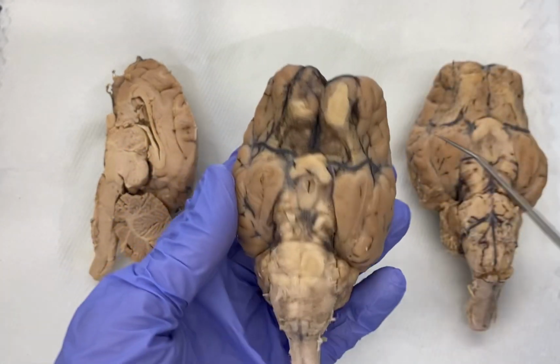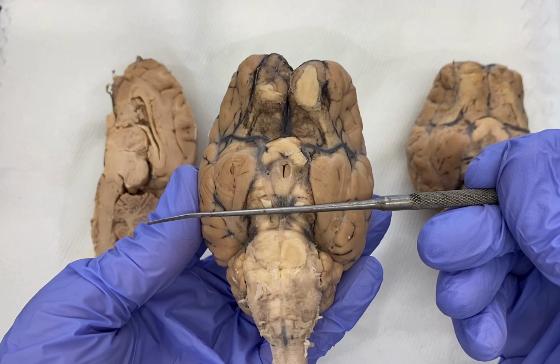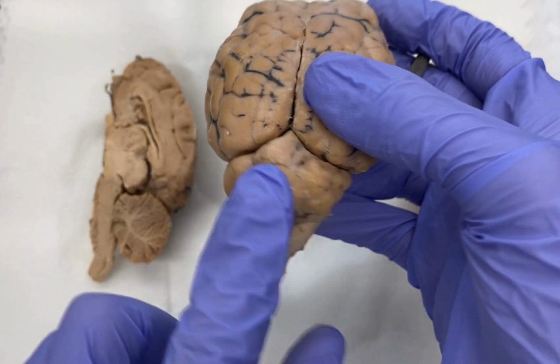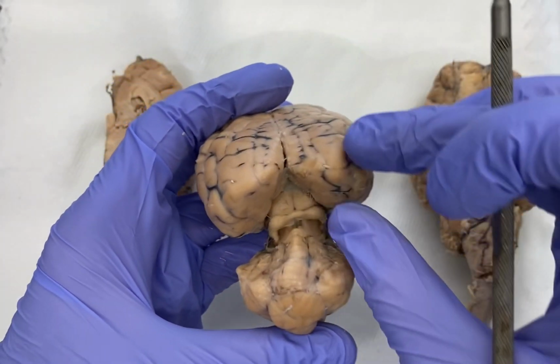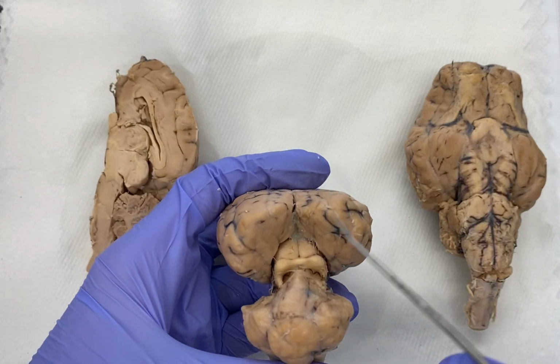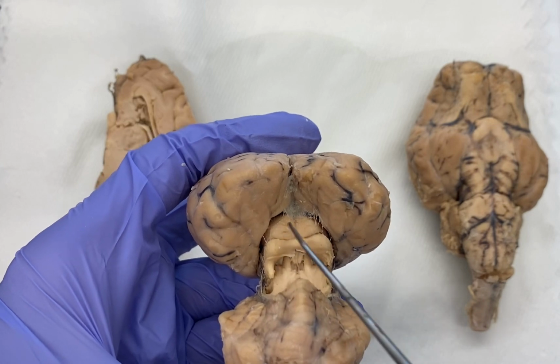Now, if we focus here on our midbrain for a second, and we're going to come back to this ventral surface of the brain in just a little bit, but if we focus on this midbrain, but we turn the brain over, and we pull our, remember what is this structure? This is our cerebellum. We pull our cerebellum away from our occipital lobes. So here are our two occipital lobes, and here's our cerebellum. We can see this superior part of the midbrain, and this is called the tectum.